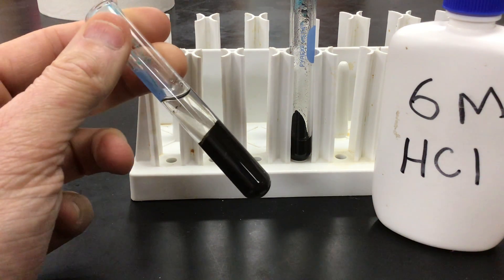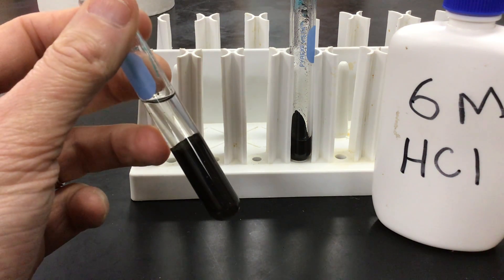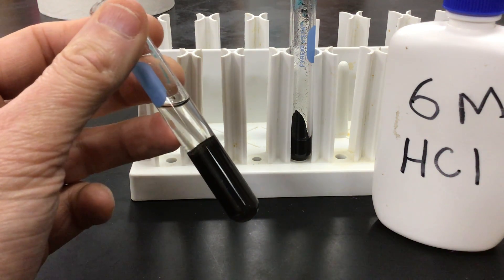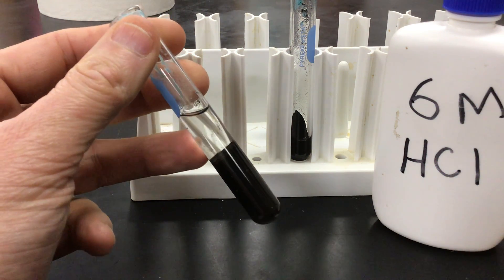Even a brownish-black color, if you can see. It's hard to see in the video, and there's also liquid on top of it. Well, that liquid is actually water. So this is a combination of water and copper oxide.